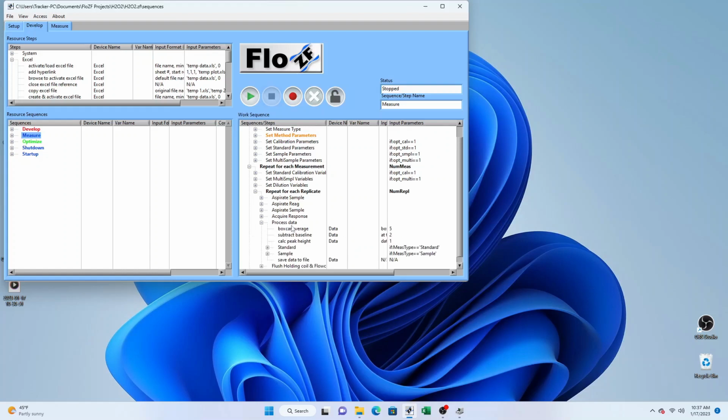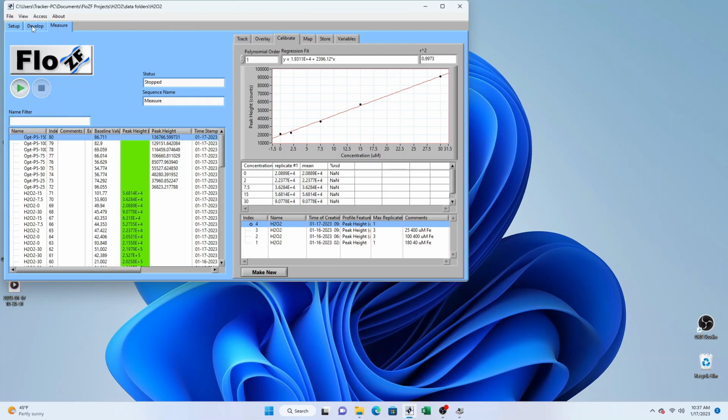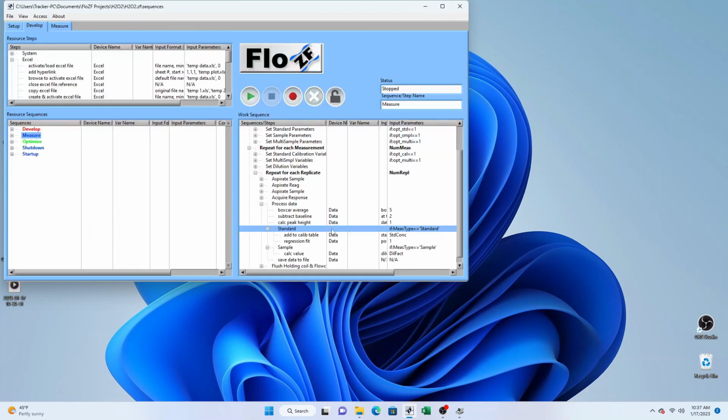Then begins the process data subsequence. In this sequence, we take a boxcar average of the data to smooth it out. We subtract the baseline, calculate the peak height, and then depending on whether the measurement type is a standard or a sample, we either add it to the calibration table and carry out the regression fit on the available data, or if it's a sample, we calculate the value, and saving that data to file not only puts it in the results table, but it also gives us a copy of all the data that was obtained during that run. Final step is to flush the holding coil and the flow cell so that we begin with baseline conditions.